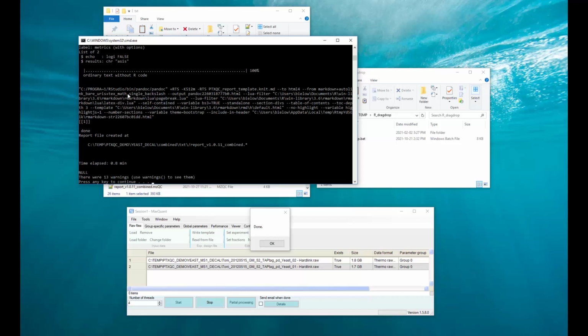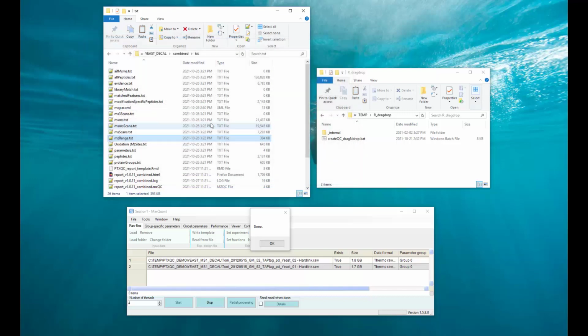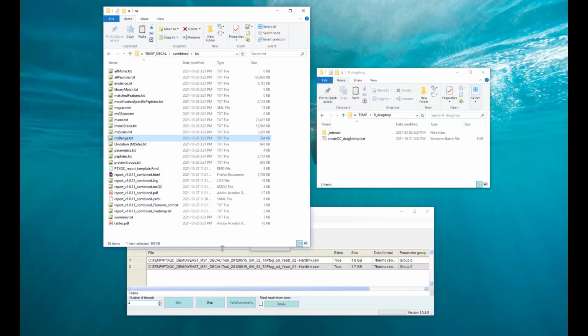So welcome back. PTXQC finished in just under a minute. So we can close this window, and now you can see some additional files which were created by PTXQC. The most important one is probably the HTML report, which is a rather large file because it contains some images which are embedded into the HTML.